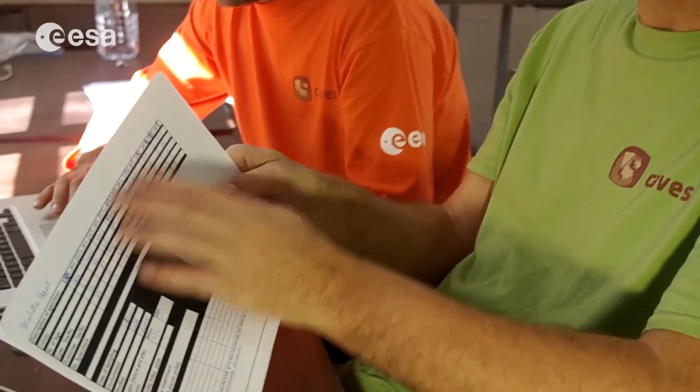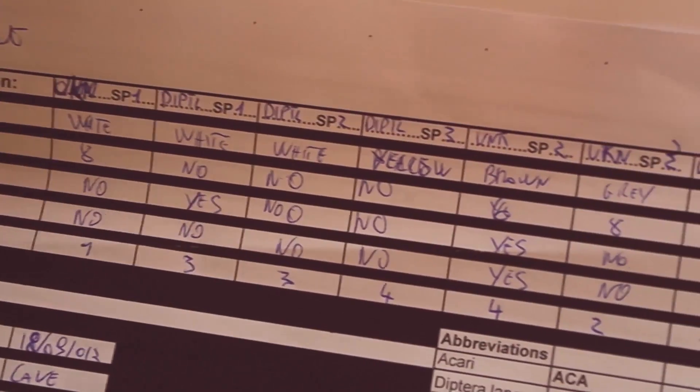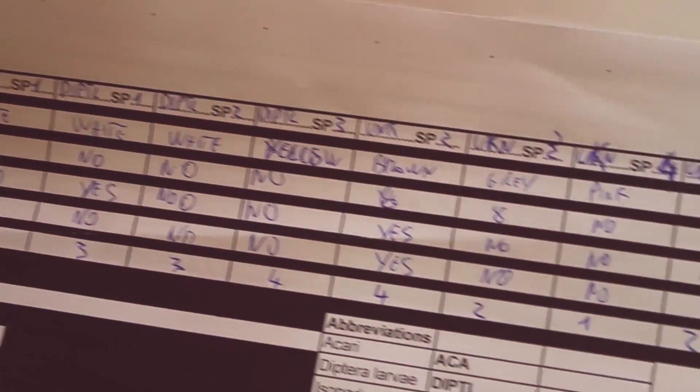What you have to mark down is the species name — we told you earlier how to identify a new species — and then the number of specimens of that specific species. We have almost completed this; we have 25 and just the last one remaining.